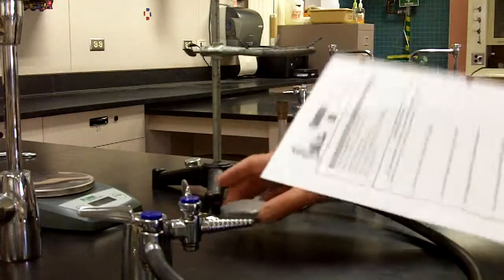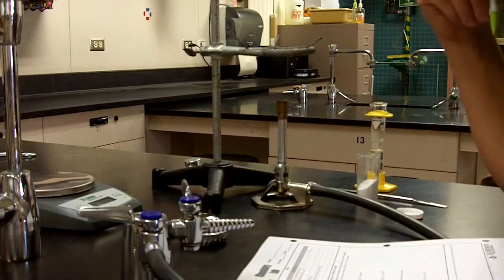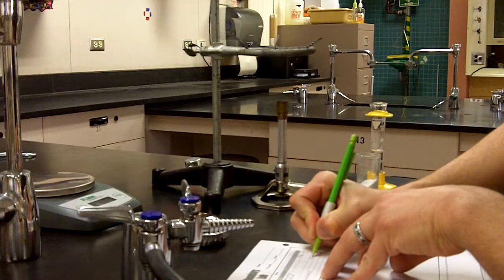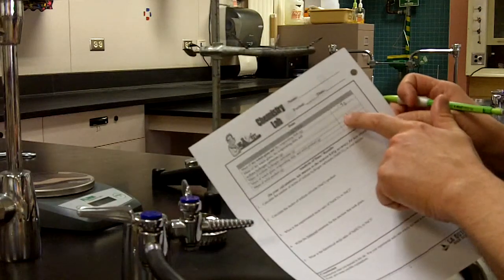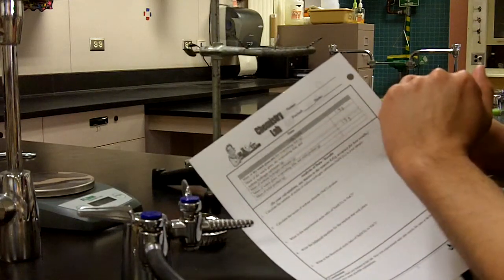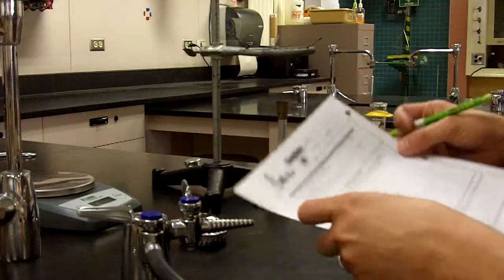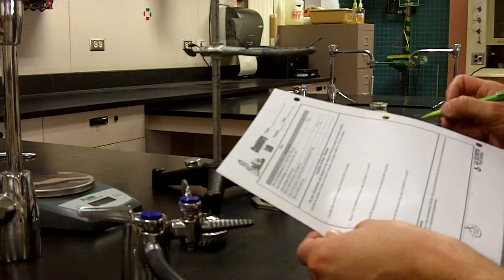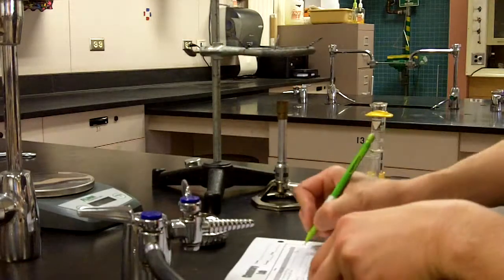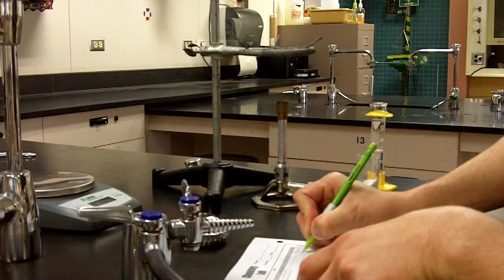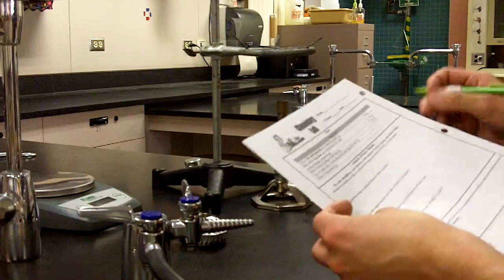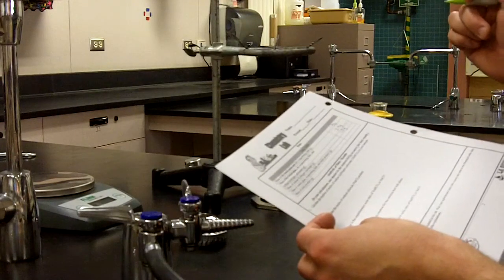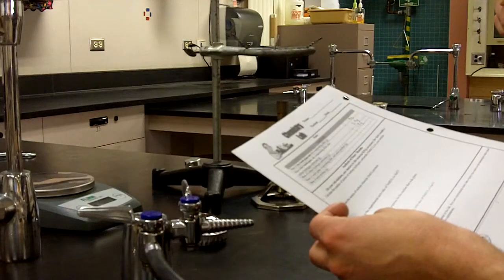I want to turn my lab sheet to the data table side. On the third line it says mass of sodium hydrogen carbonate, I want to put 1.0 grams in that position. In the spot that says mass of dry evaporating dish and sodium hydrogen carbonate, 1.4 plus 1.0 is 2.4 grams. So I write 2.4 grams there. You can see 2.4 minus the 1.4 of the dish is going to leave us with the 1.0 grams for our baking soda. The other two spaces are for the conclusion of the lab.